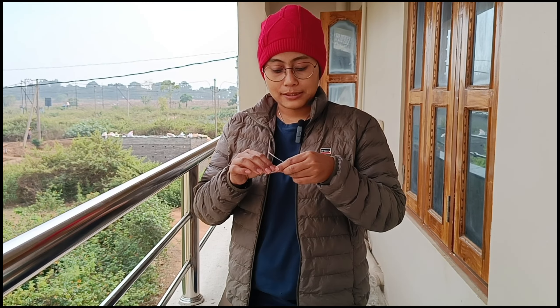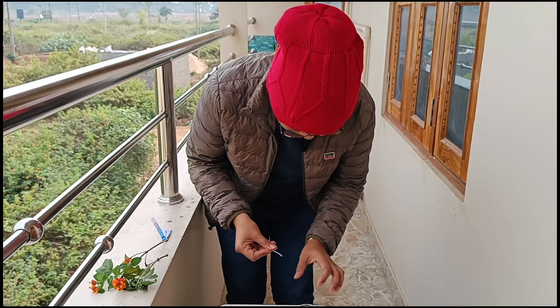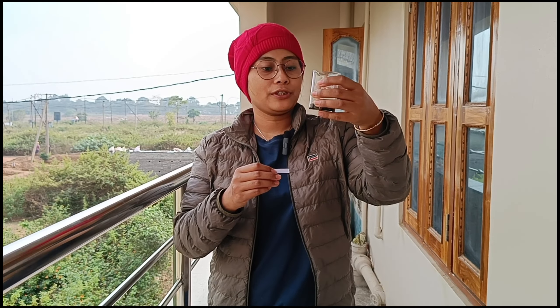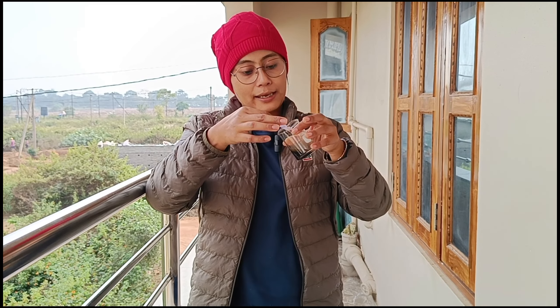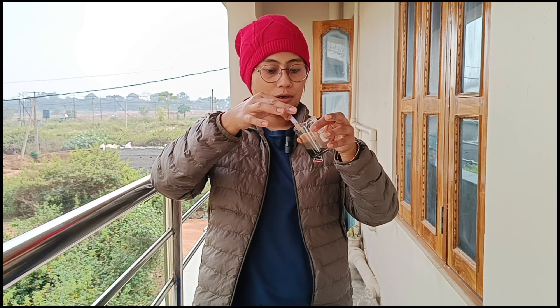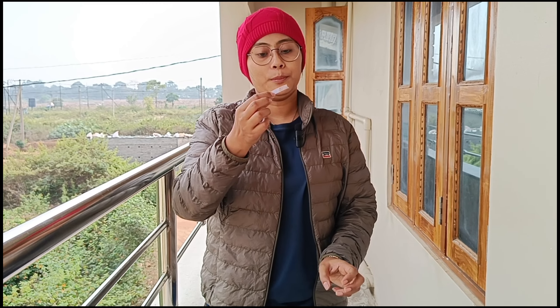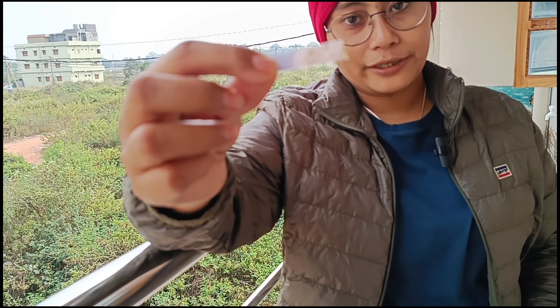We have dissolved some of the fruits in distilled water, and this is how the color looks like. When you dip a piece of blue litmus paper into it, this is the color you get — it is dark in color.